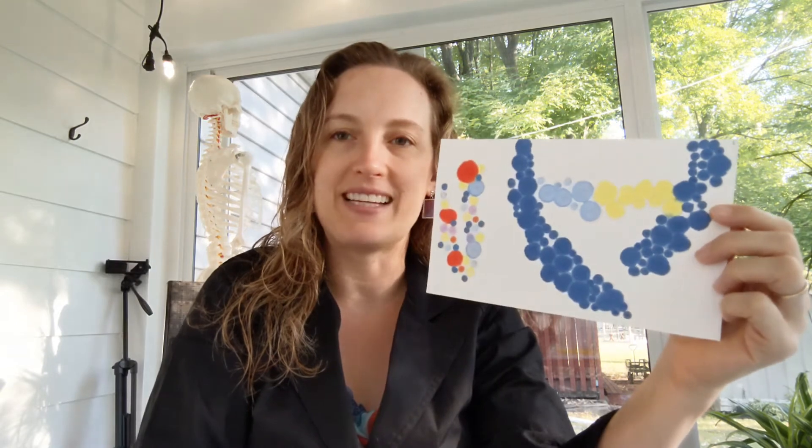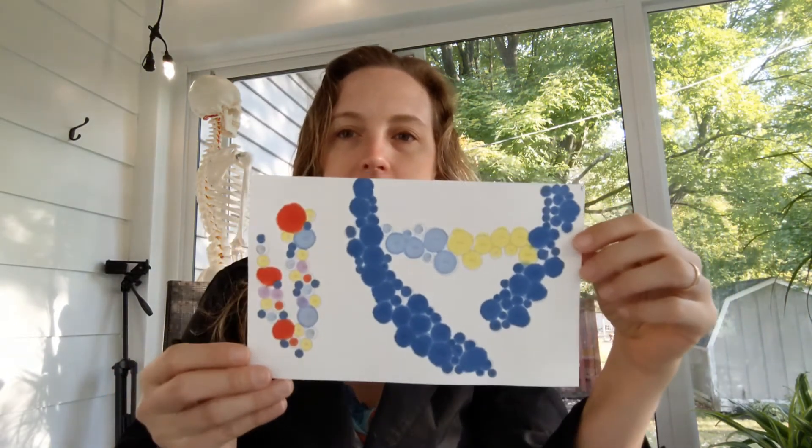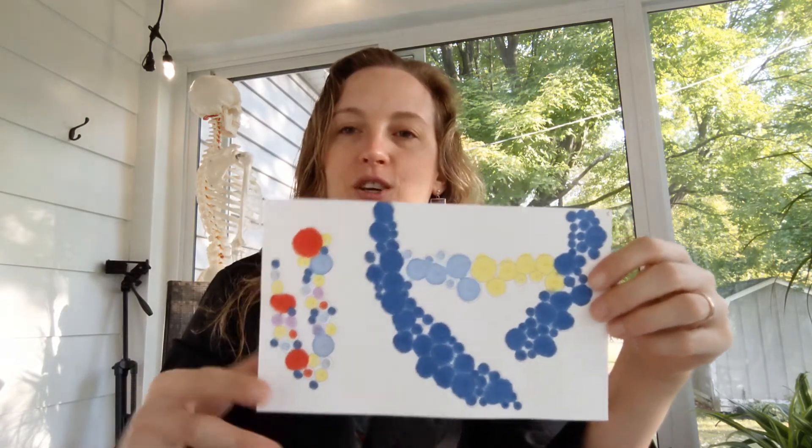If you need to social distance your kids, they could take turns at the station. But part of what I love about this is they can't necessarily tell from their piece what the total picture is going to be. But when they're done, you put it all together and you get this beautiful piece of art.